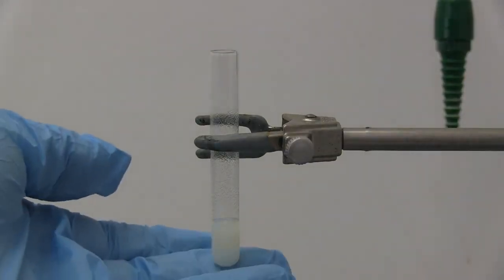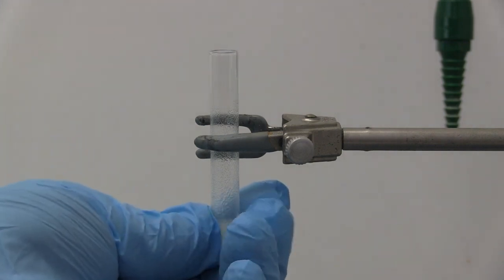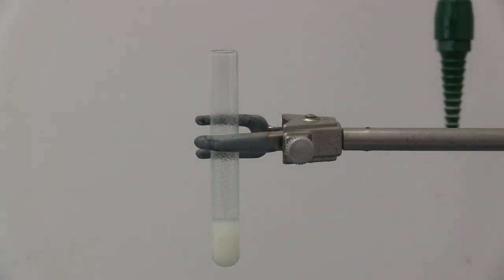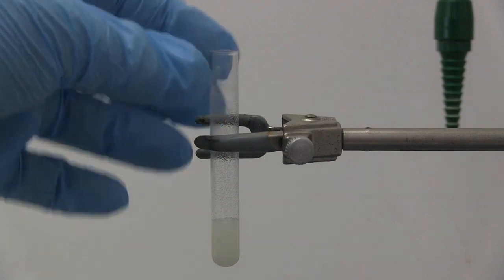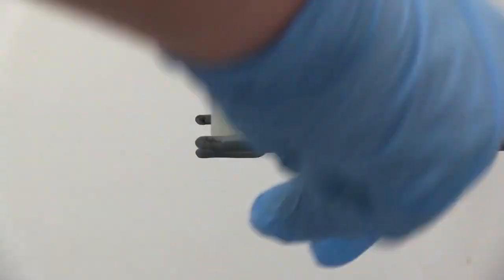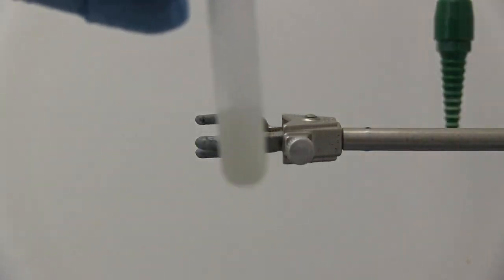Alright, so it didn't look like a lot of my crude caffeine dissolved in the ethanol so I'm going to take this test tube and put it aside, let it keep recrystallizing because there's definitely some solids in there. I'm going to try this again.